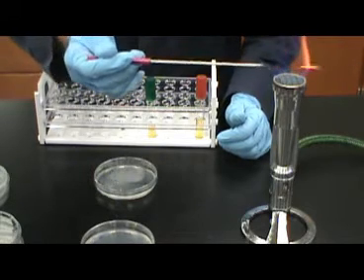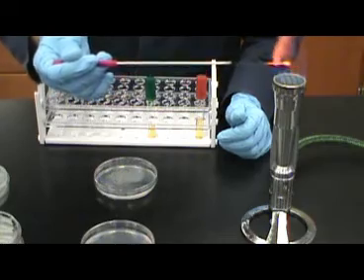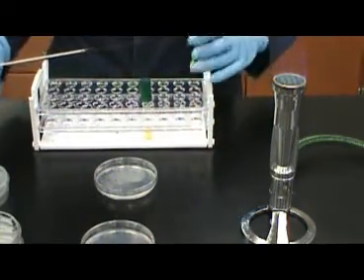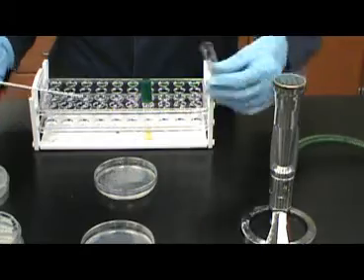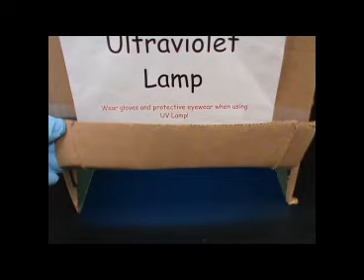The longer the exposure to the UV light, the more damage is done, and the more mutations accumulate. Bacillus, as an endospore-forming bacteria, is capable of protecting itself from extended UV light exposure, whereas Serratia, incapable of forming endospores, is not.